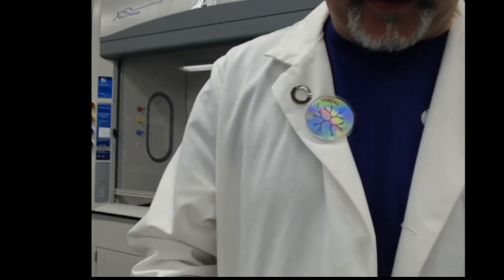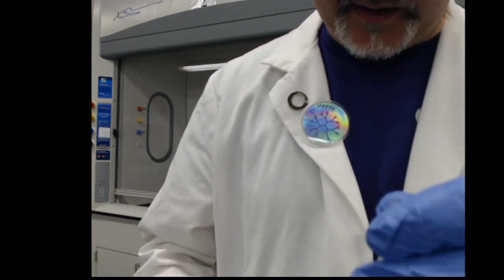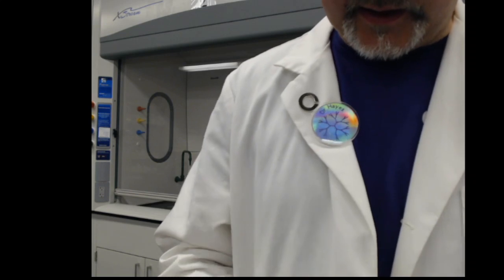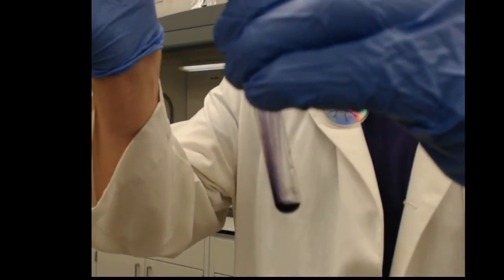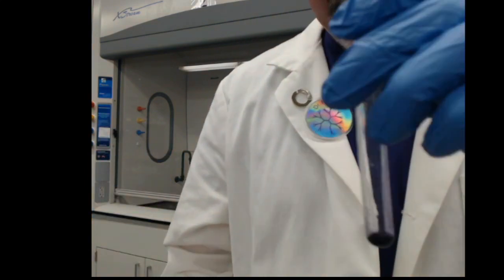You go to your methyl violets and we're just going to put in a couple of drops down here at the bottom. Make sure you get a clean test tube. So I'm just going to put a few drops down here at the bottom, not a whole lot, probably two or three drops.